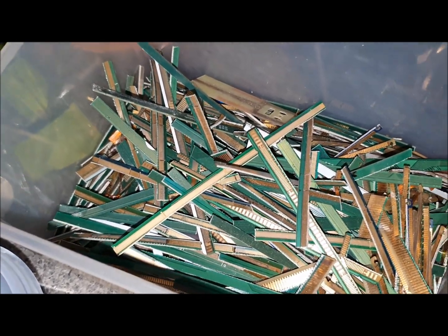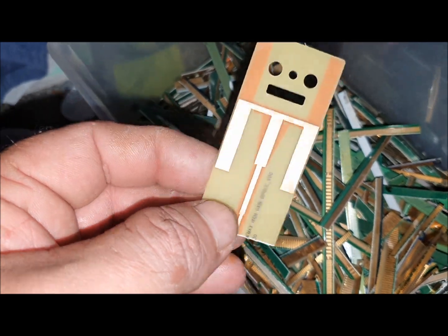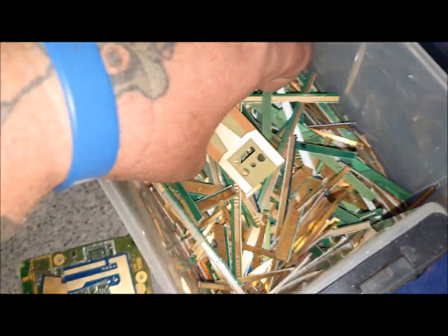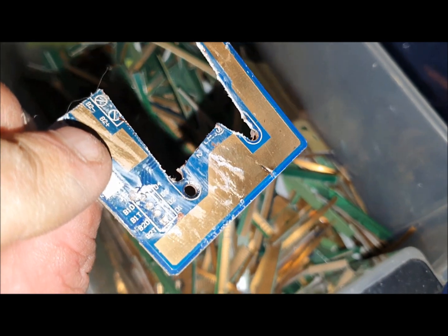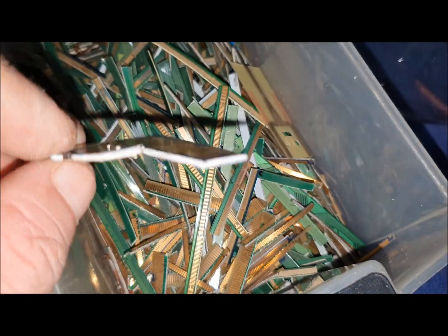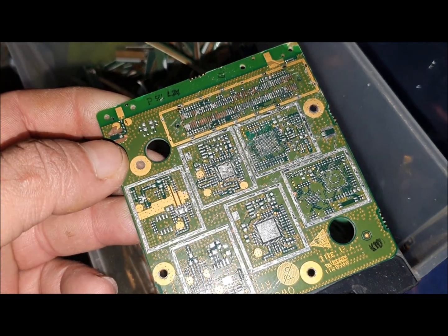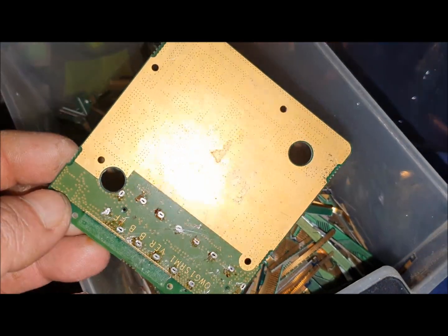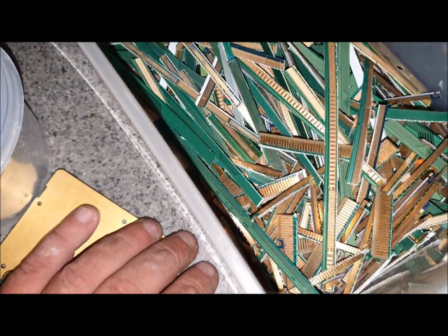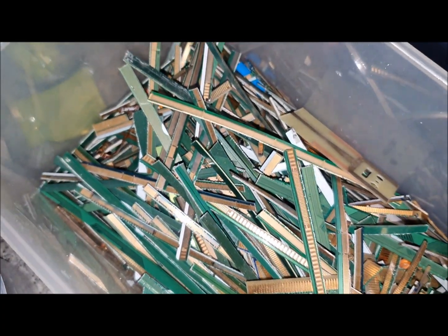When I decided that, I figured I might as well just start collecting all fingers and do a big batch, which is what I've got here. These are from an internet router, so everything in there is just fingers. Apart from that, I just found these — they've got quite a bit of gold on them. Now there's some solder on there, so these ones are going to have to sit in some hydrochloric acid to get rid of the tin. This one here is negligible — you could say it should just go in AP because there's not much gold, but when you turn it over there's quite a bit. So I'm going to put those few pieces into HCL.